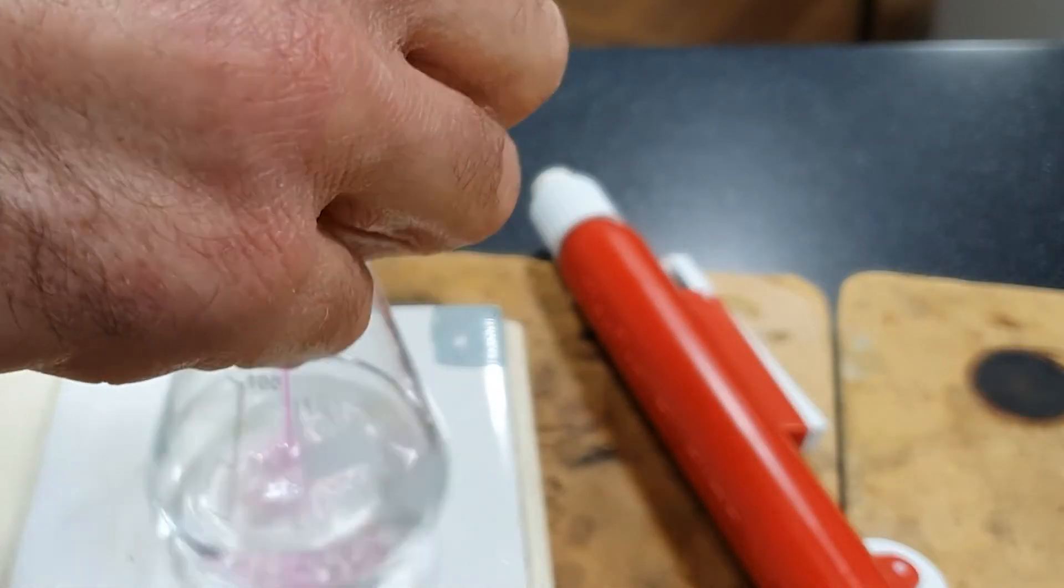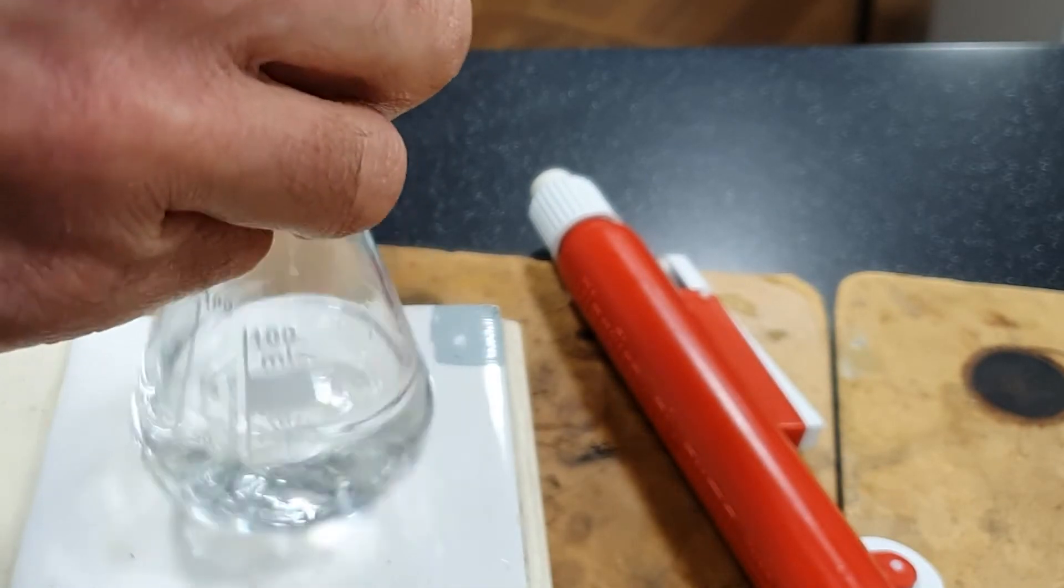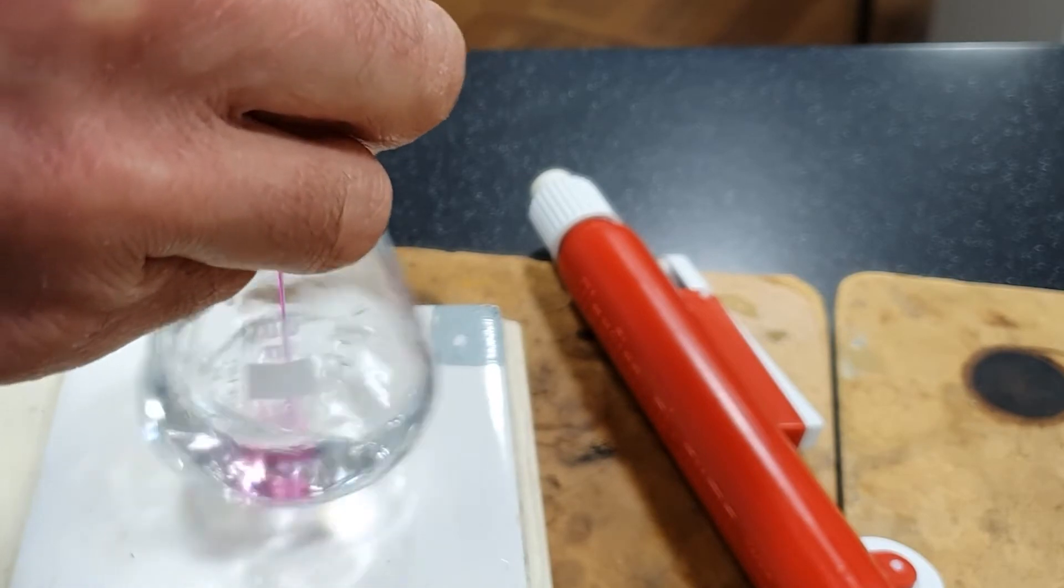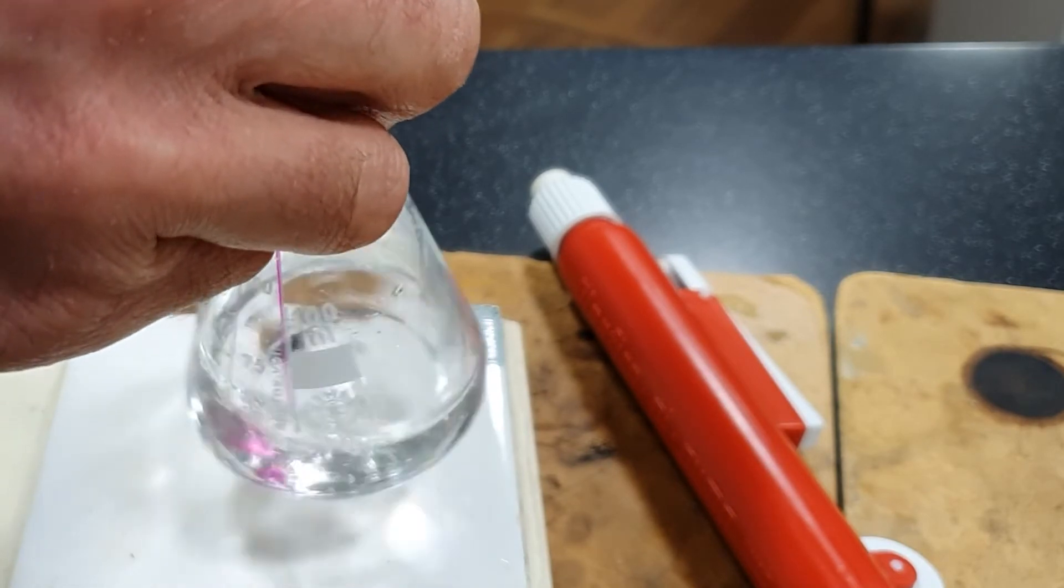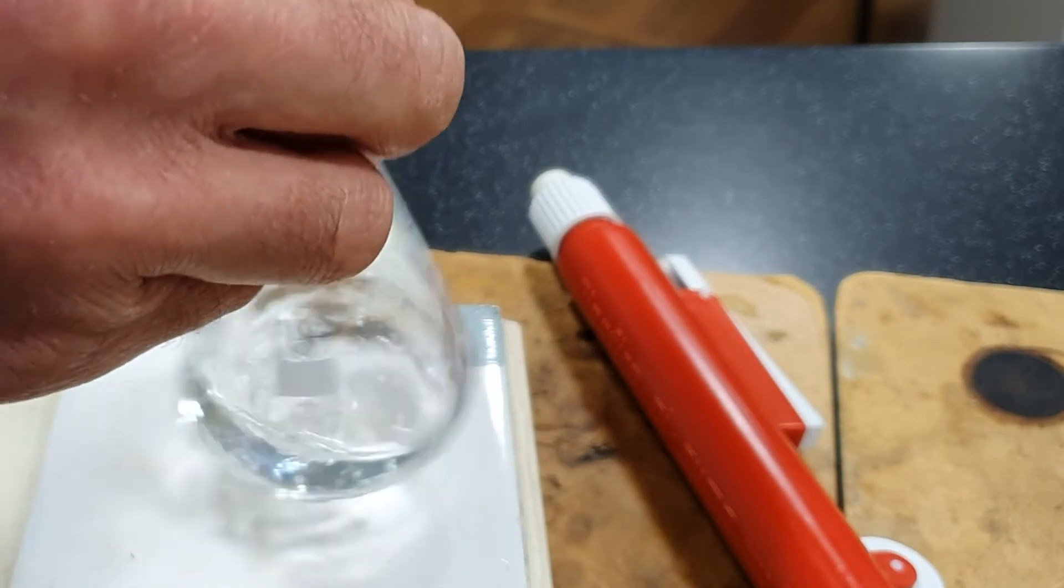Perform the second titration. Hopefully the end point will be a little bit more accurate than the first one. What do you think, am I going to hit the end point?